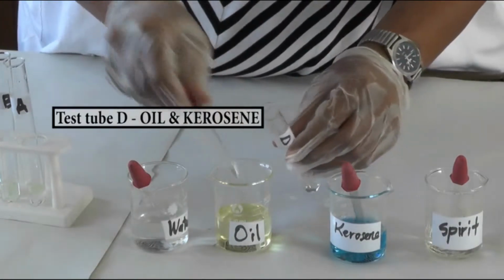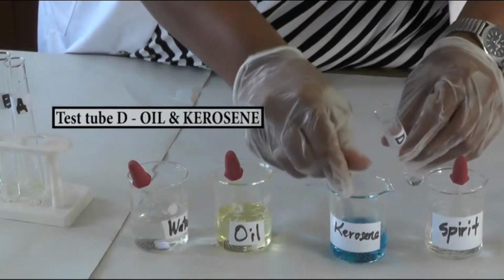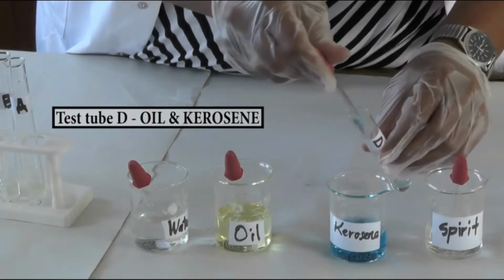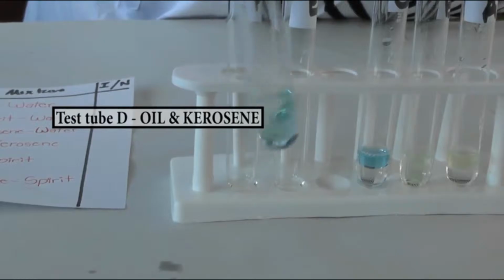Do the same as you did for the previous one. Mix. After mixing, put them back on the rack.